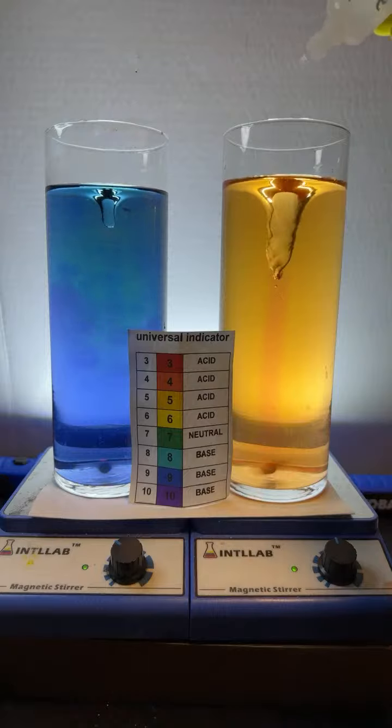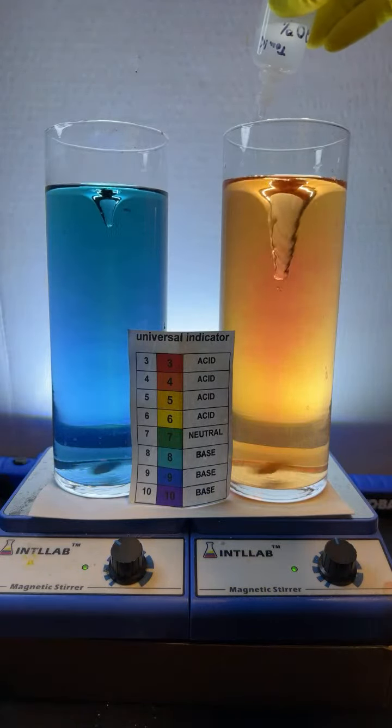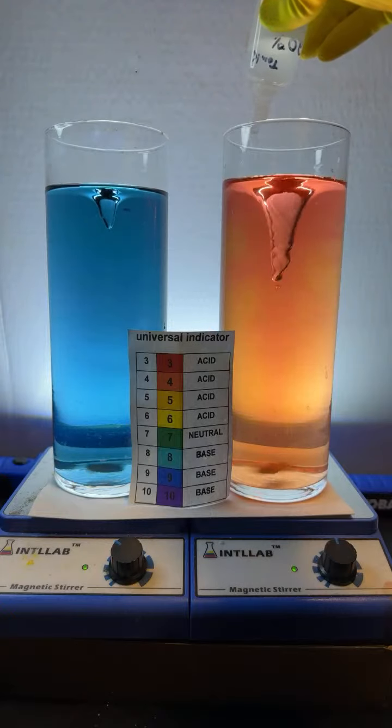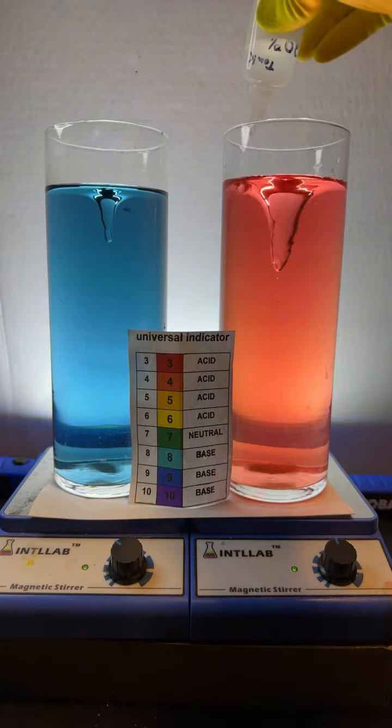Make it go to red. You got it, Christopher. I'm going to add a bunch of acid over here on the right. And I wouldn't trust it's balanced either. So I'm adding a bunch of acid over here on the right. And you can see that nice red color grow in as we get down to pH 3.